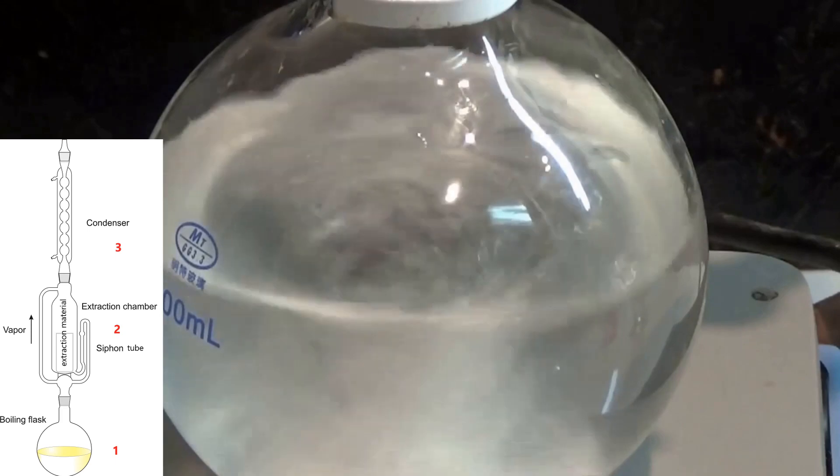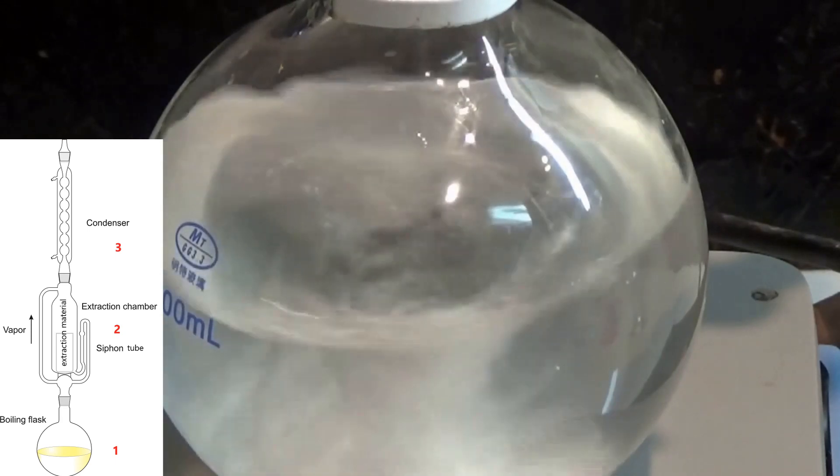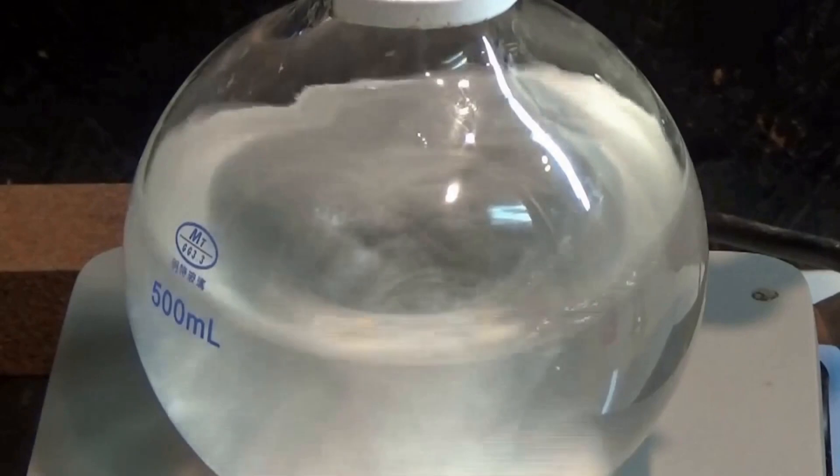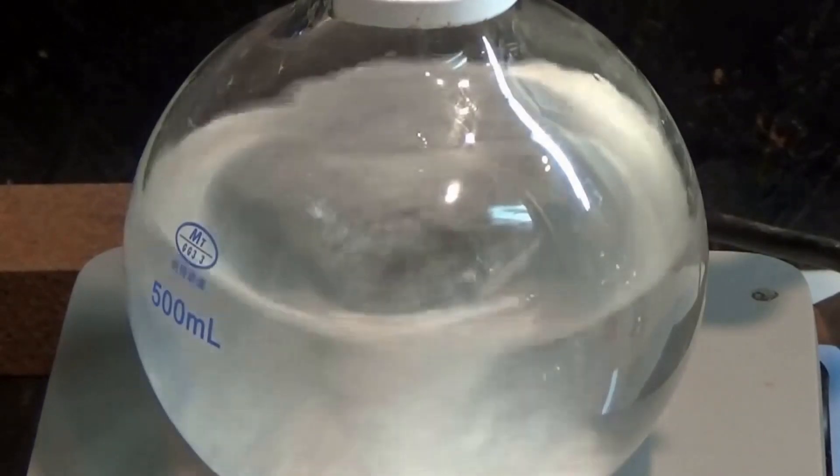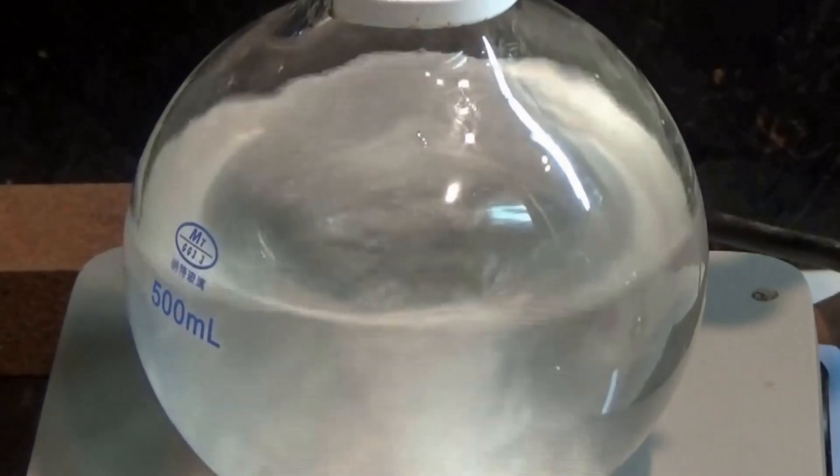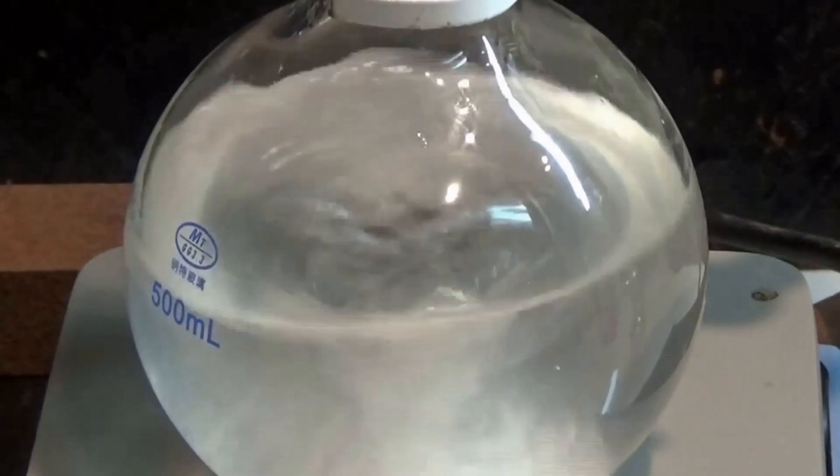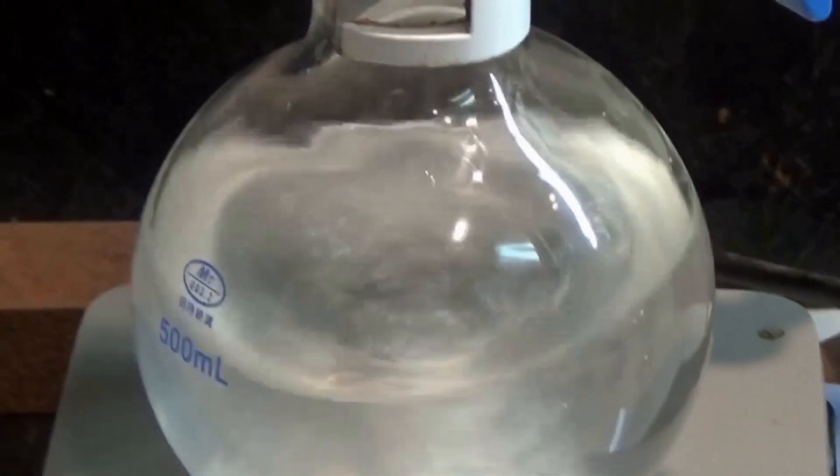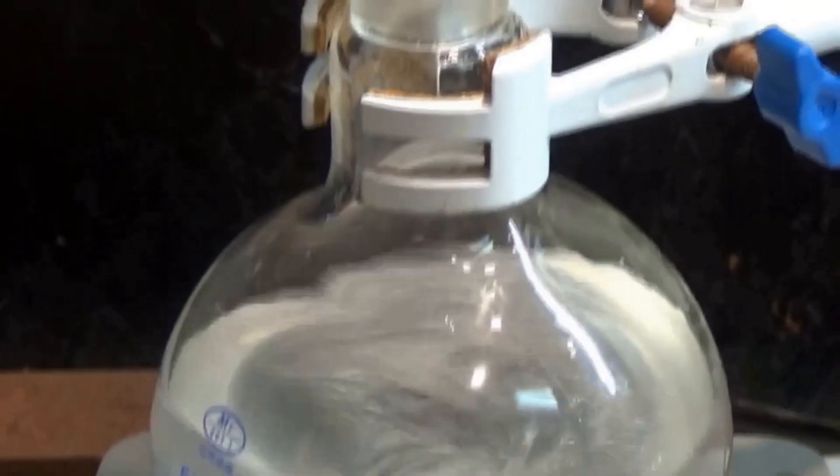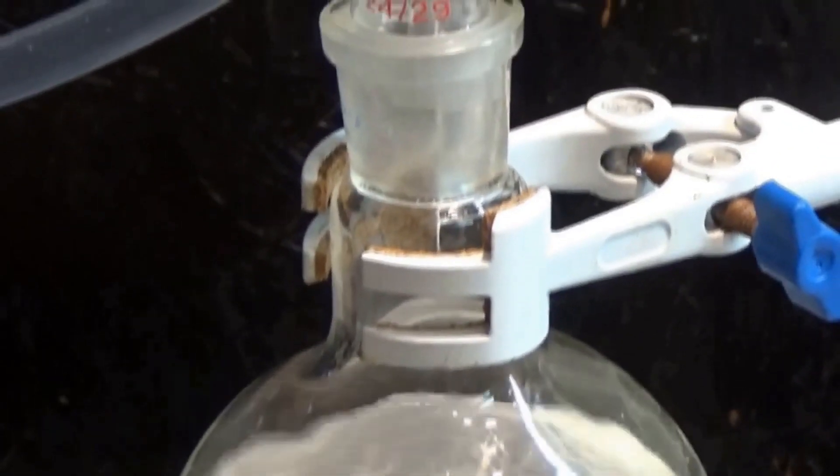The beauty of this process is that each extraction cycle is performed with the same solvent, but the solvent is always fresh because it is continuously distilling into the extraction chamber. This allows you to extract nearly a hundred percent of the soluble molecules.